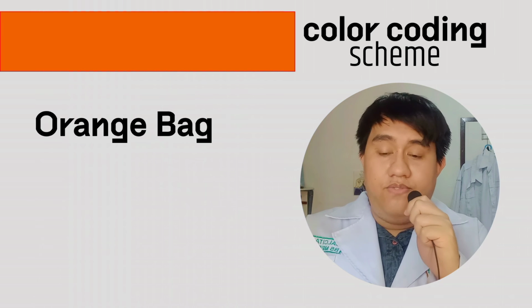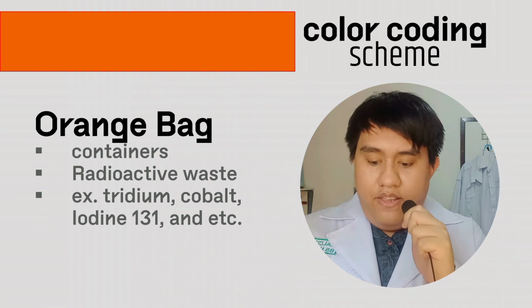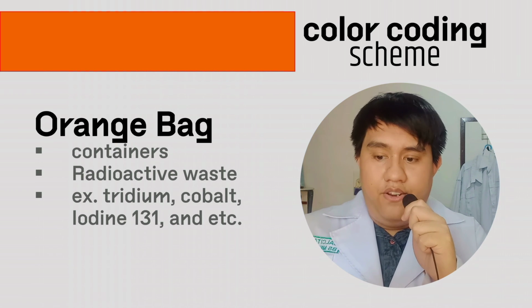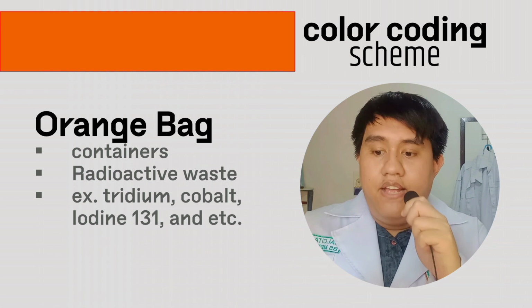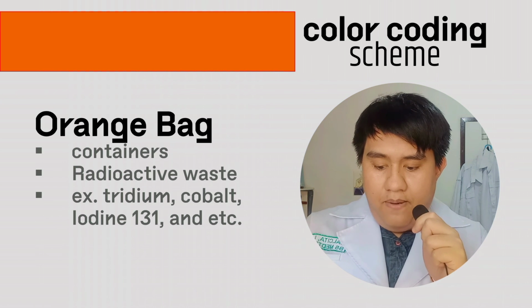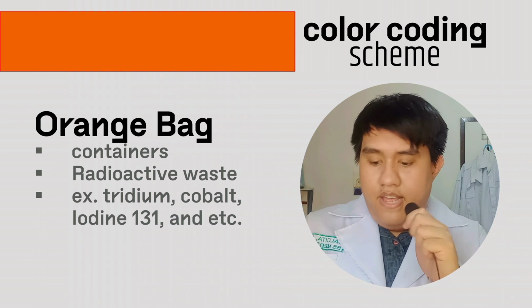Last one, we have the orange bag. The orange bag represents radioactive wastes, and it has simple containers, and it has a radioactive type of waste. Examples for this are tritium, iodine-131, and the like.